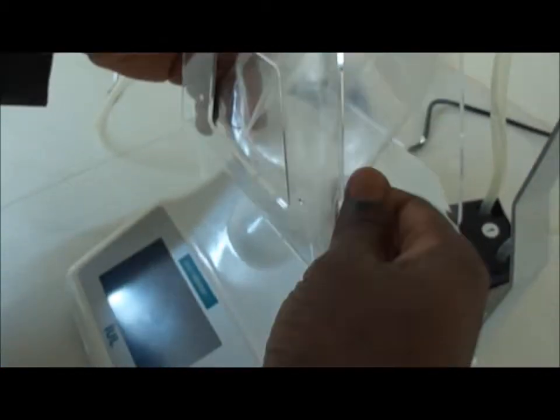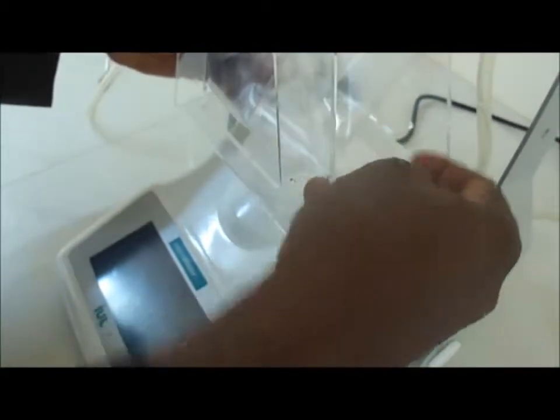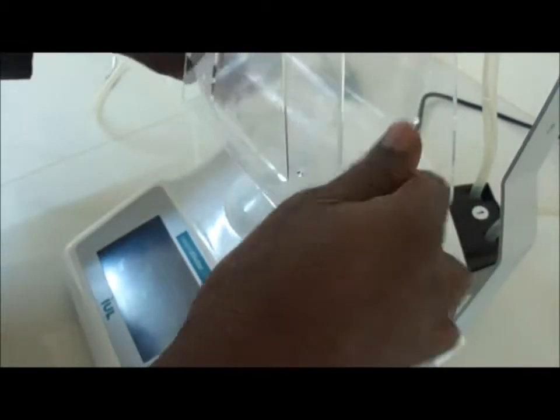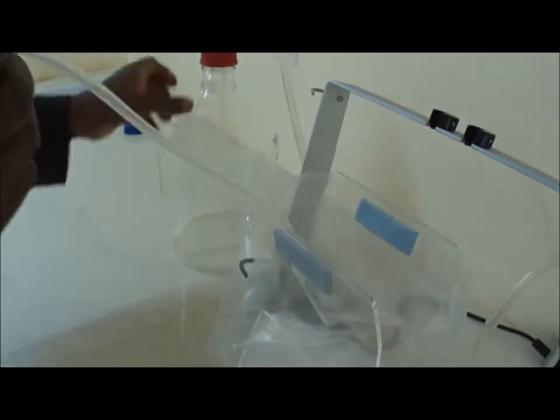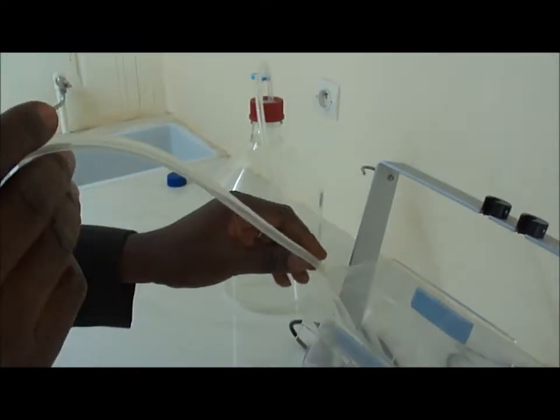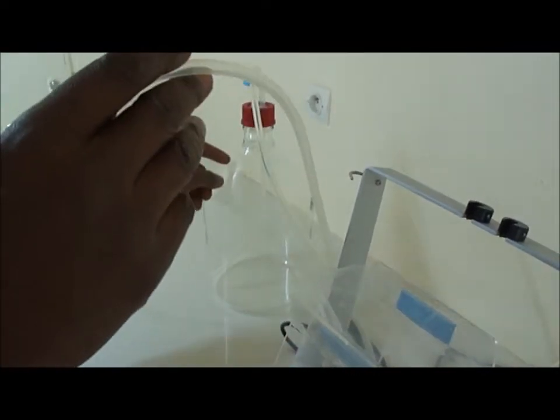And then you keep this very neat at the basis here. And now we can connect using the tubes, the pipes coming from the bottles.